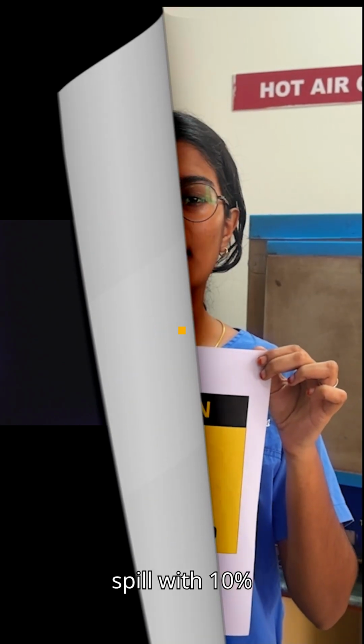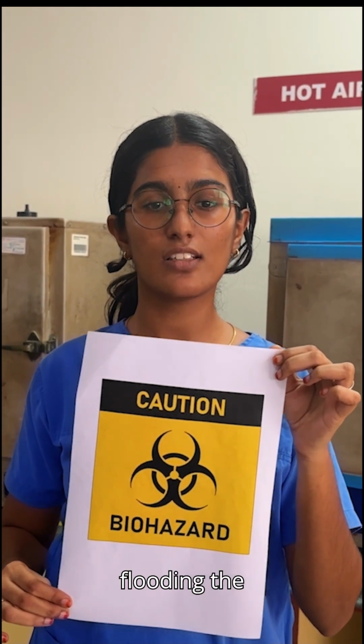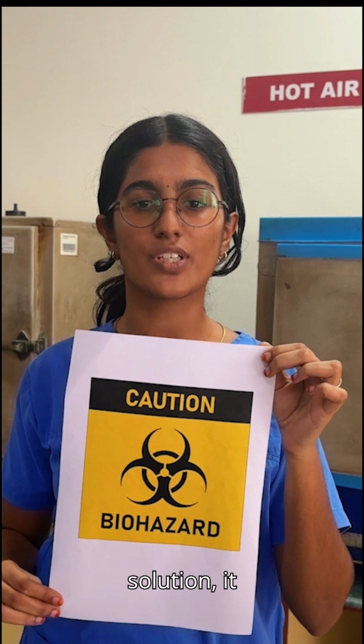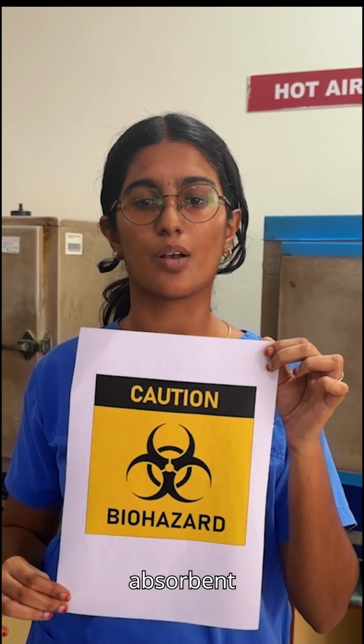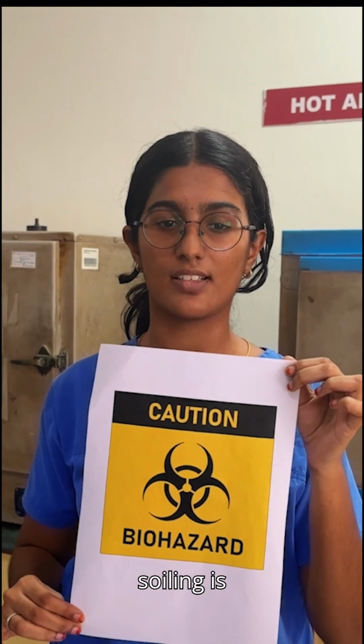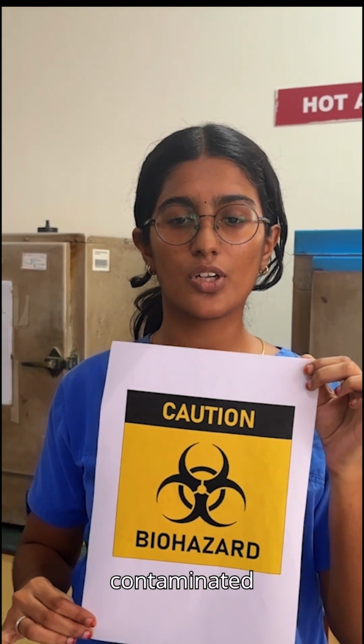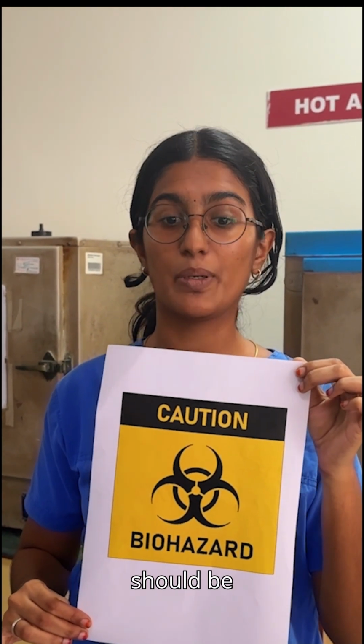Flood the spill with 10% hypochlorite if it is a large spill greater than 10 ml. While flooding the spill with 10% hypochlorite solution, ensure that both the spill and absorbent material are thoroughly wet. Repeat the steps until all visible soiling is removed. Wipe the area with a cloth mop moistened with 1% hypochlorite and allow it to dry. All contaminated items used in the cleanup should be placed in the biohazardous disposal yellow bag.